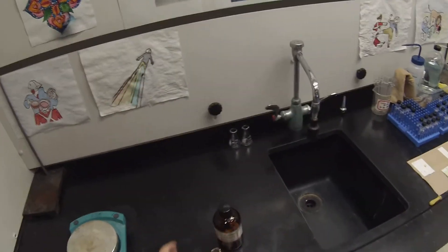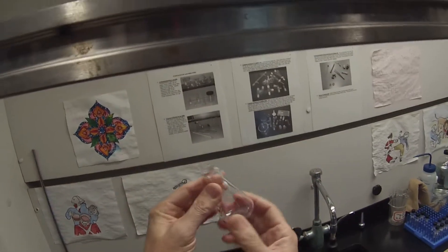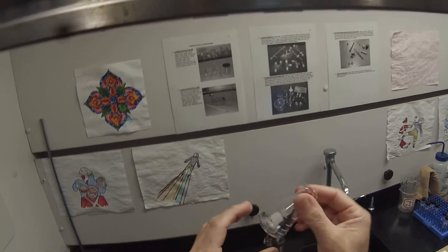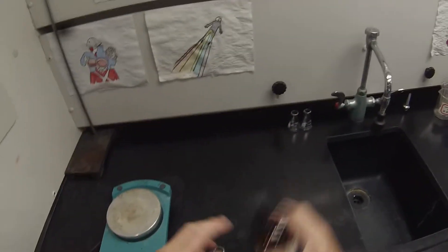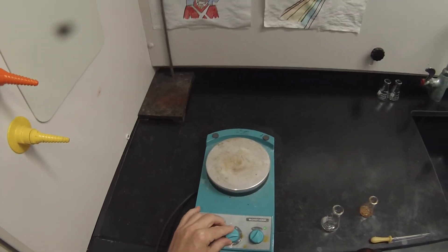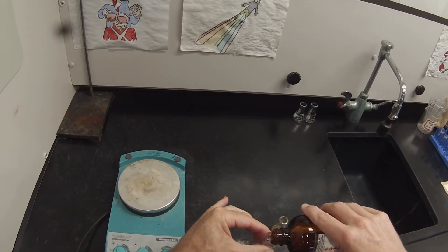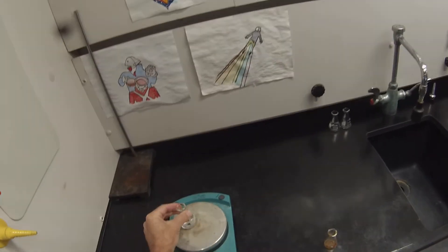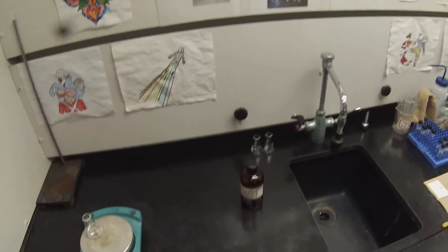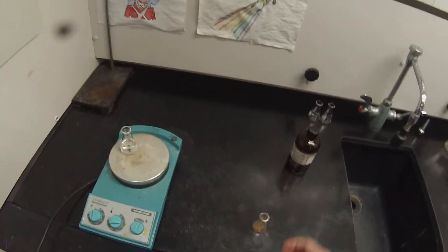So we could try to recrystallize it from pure hexane, since it didn't work from the hexane-chloroform mixture or from the pet ether-ethanol mixture. I put a boiling stone in and I'm going to boil some hexane, turning on the hot plate. I'll get about 20 ml of hexane boiling, and I'm going to add another boiling stone to our tryptamine mixture and we'll give this one a shot.